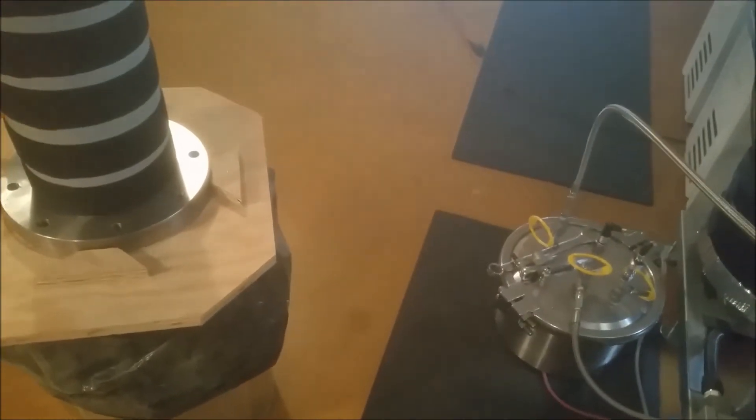Those two tanks have to have the vapor pressure recovered. The automation system takes care of that for me, but I could do that manually as well.